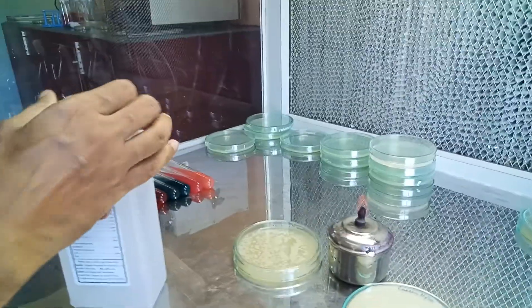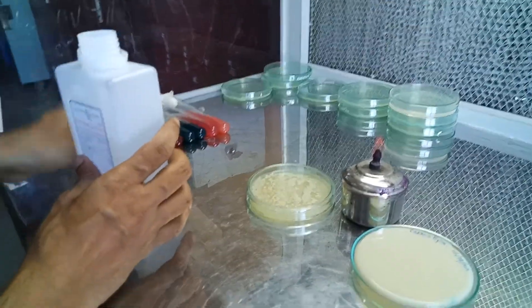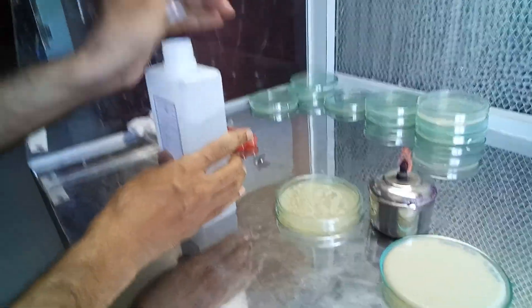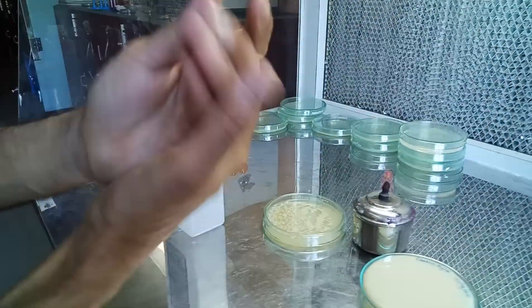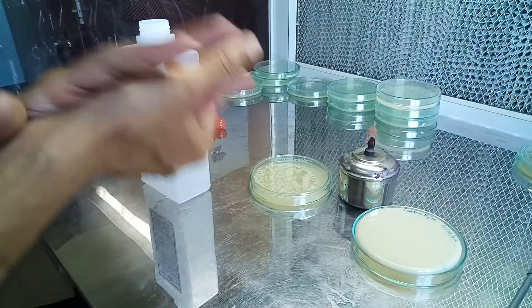Hello everyone, today we will be performing the casein hydrolysis test. Before we carry on with any microbiology, we need to sterilize our hands first.